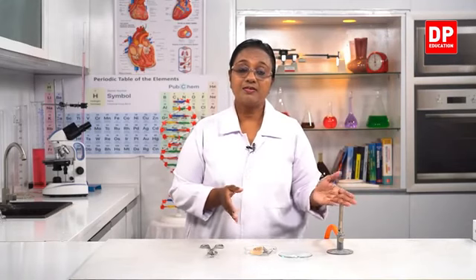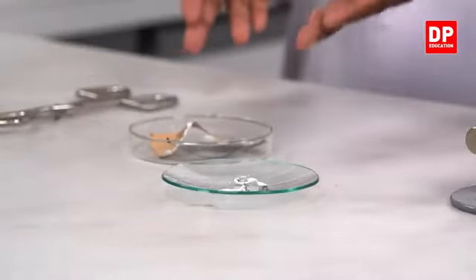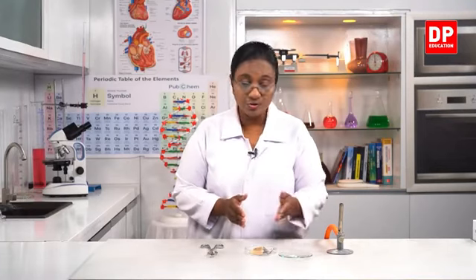No, that's not possible. Like in the previous activity, we heated the naphthalene balls, it became liquid. Then I showed you all at the end, after some time, the liquid naphthalene became solid. But here, even if we keep it for a day or two, still we won't get the magnesium strip back. So this is a change where we burned the magnesium strip in the Bunsen flame and it produced another white color product. So with that, I will move on to the next change in this activity.